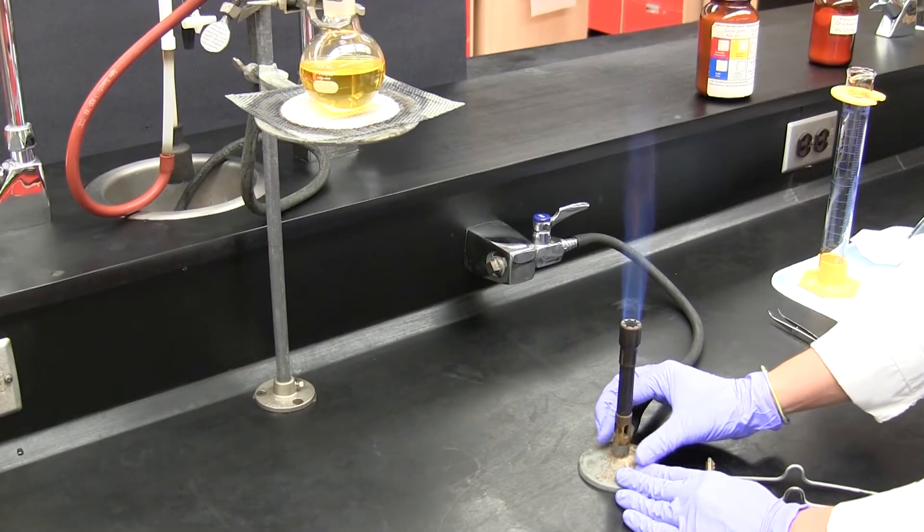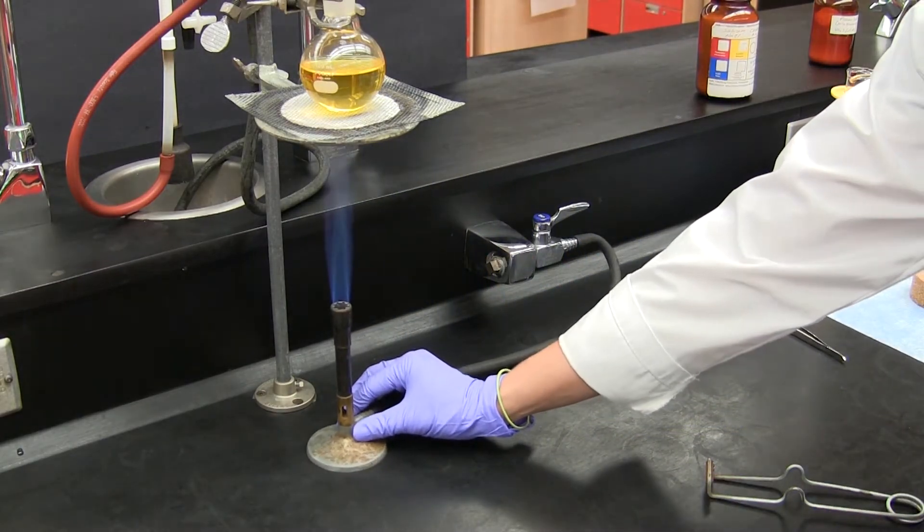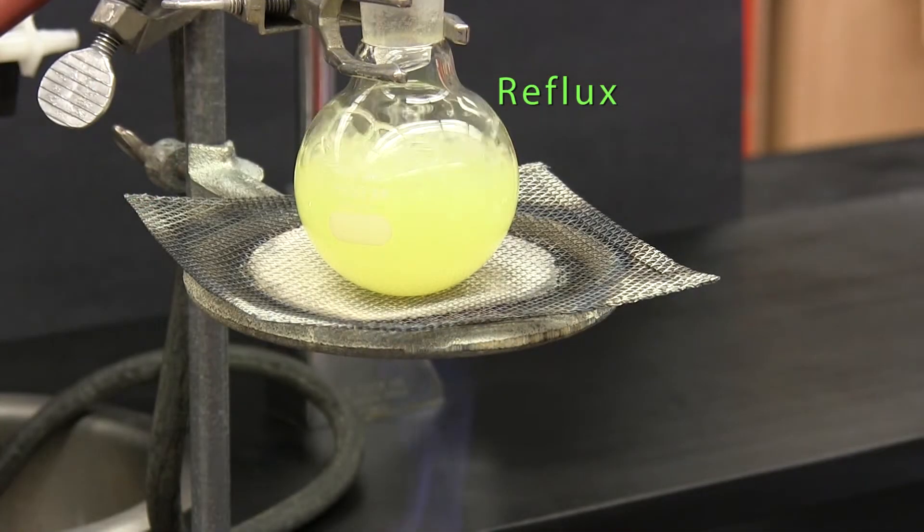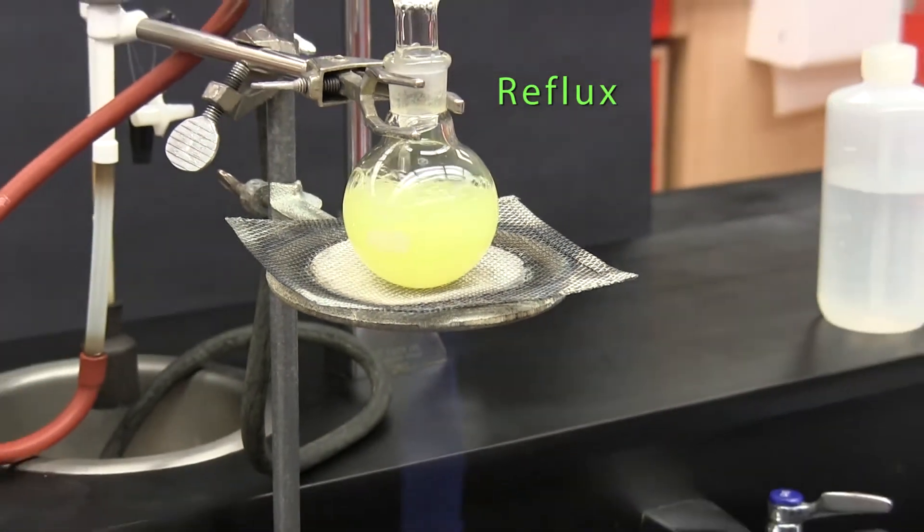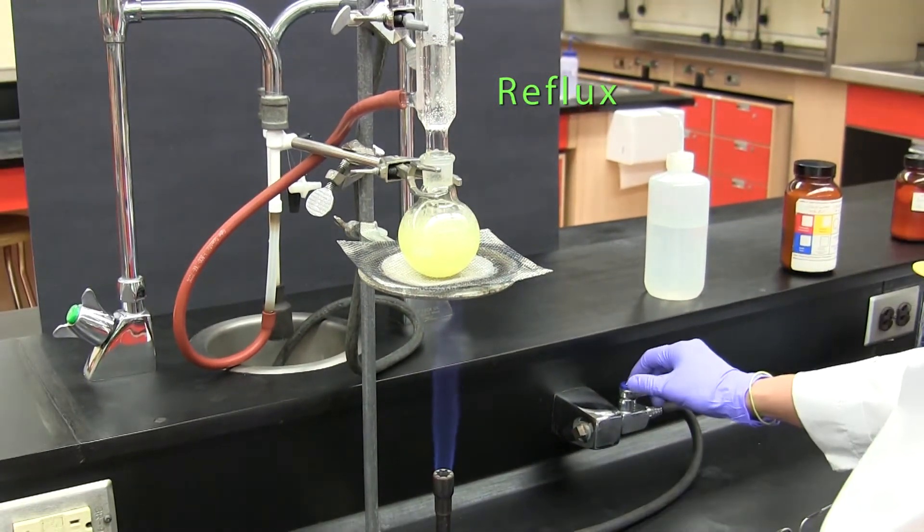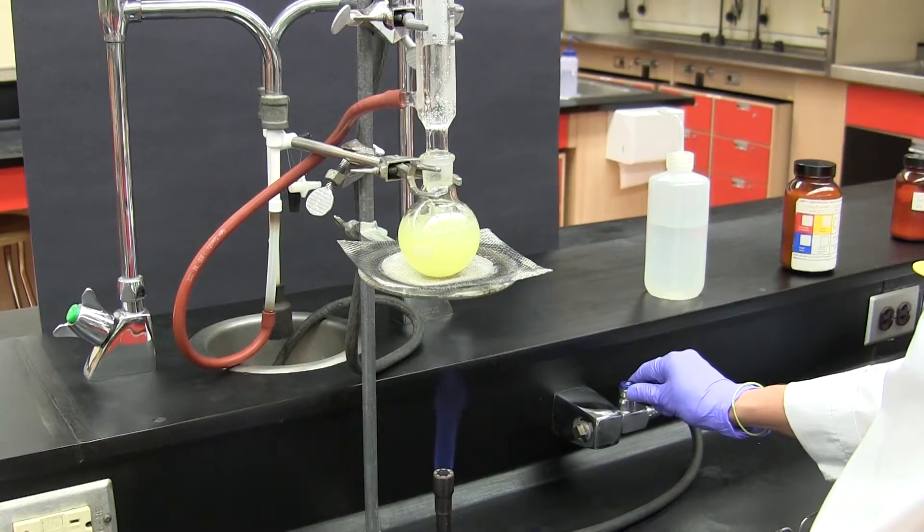In this video we're going to have a look at how to set up and conduct a reflux. A reflux is a technique used where we supply energy in the form of heat to a chemical reaction. This allows the reaction to proceed at an accelerated rate.